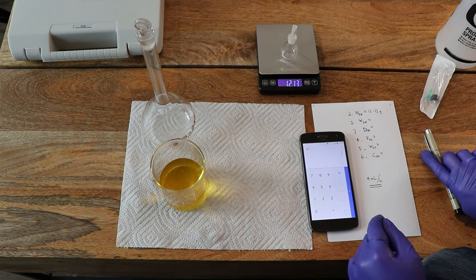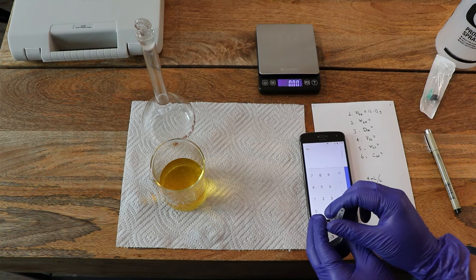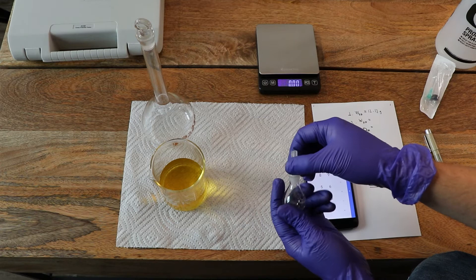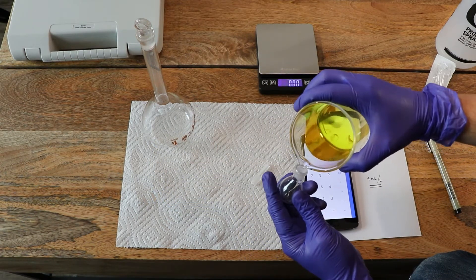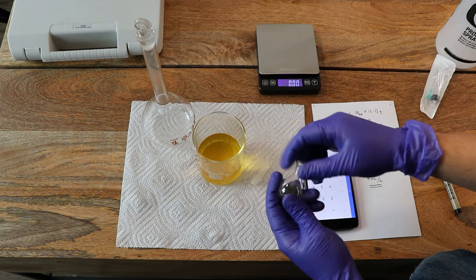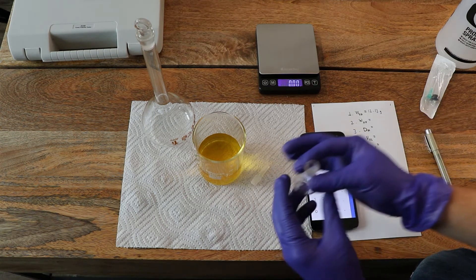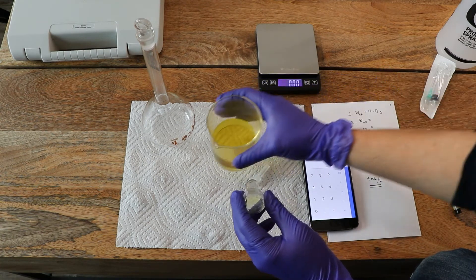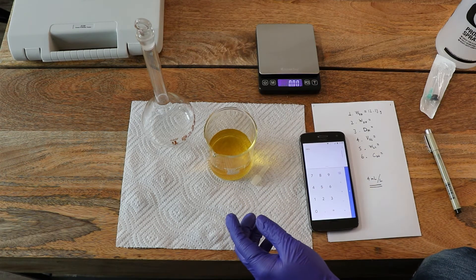If you have a more precise scale then obviously use that. I'm using this one because it's the one I have that fits the range of weights we're going to be using. Now that we've measured the dry pycnometer, we can do a simple purge with the liquid just to ensure that we're not measuring the density of anything that remains inside, so I'm just going to do a simple purge of it.